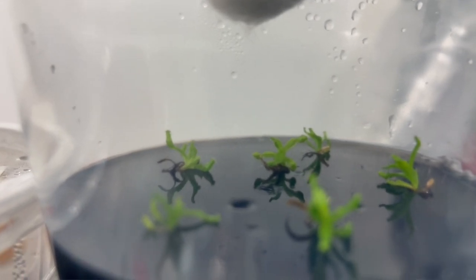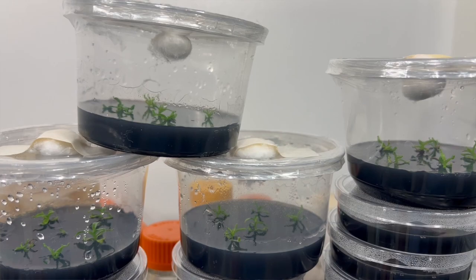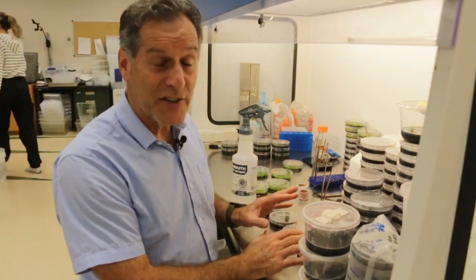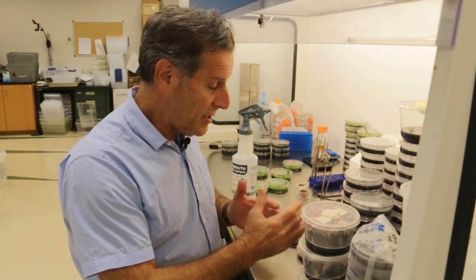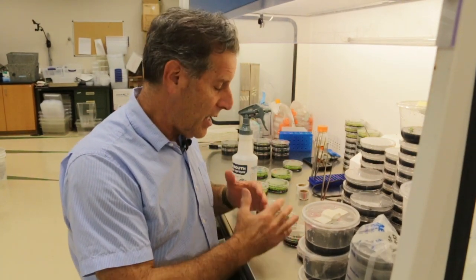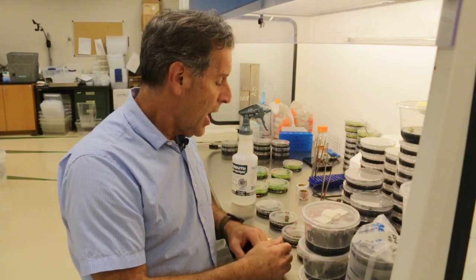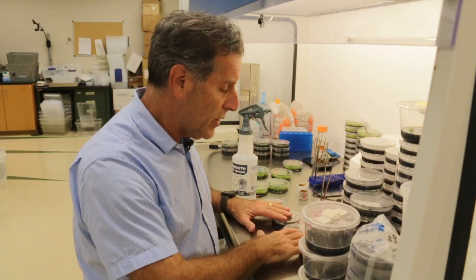The seeds were plated about five months ago. I'm not sure how fast they germinate when seeds are placed on sphagnum moss or soil, but here on a supplemented medium, they're growing fairly quickly.